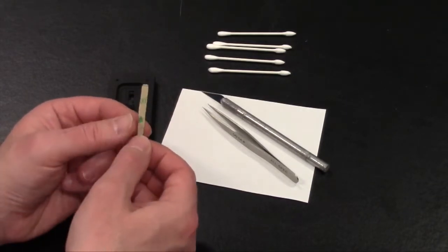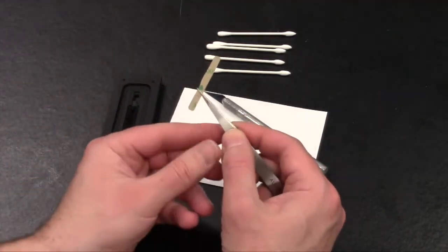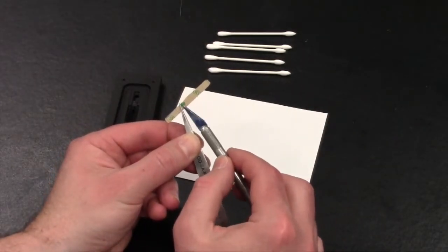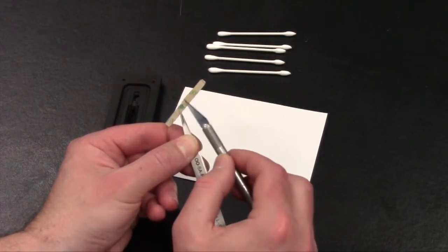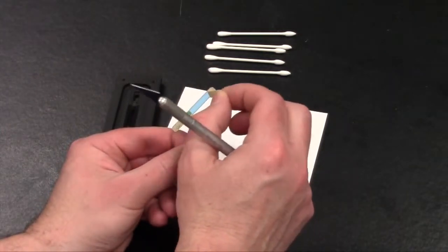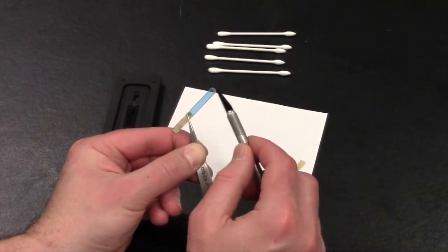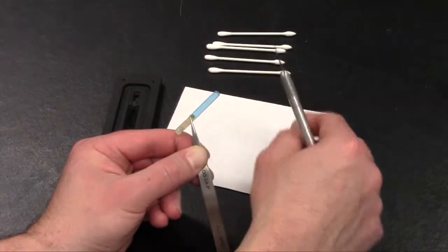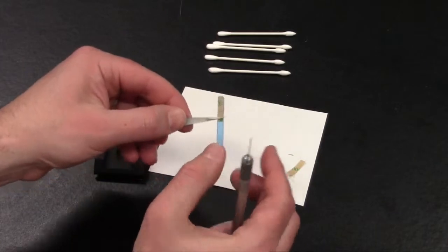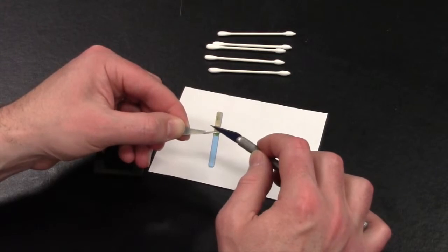slide assembly. So what you can do is, using a pair of tweezers, hold the slide assembly in the middle, and using an X-Acto knife or another type of sharp object, carefully remove some of the plastic or the adhesive covering from the back piece. And there'll be a tiny piece at the end here, so you want to remove that. And if you touch this, it's okay. We're going to show you how to clean it at the end. But by holding it in the middle, it gives you more leverage to help remove these other pieces of adhesive.